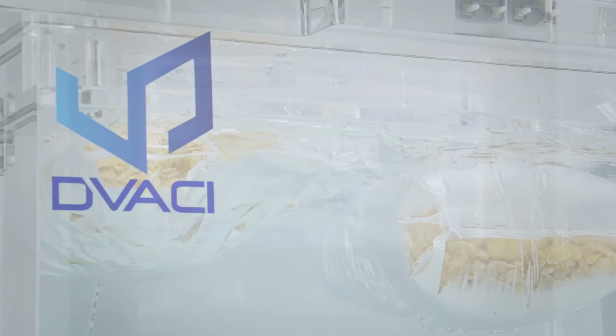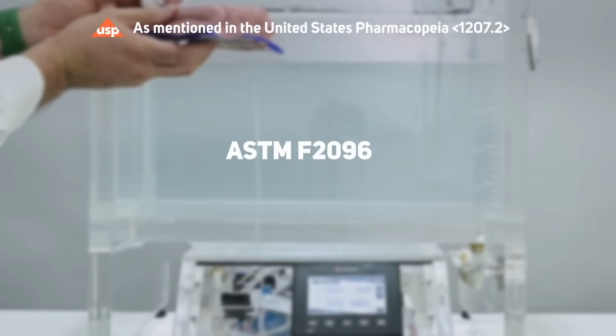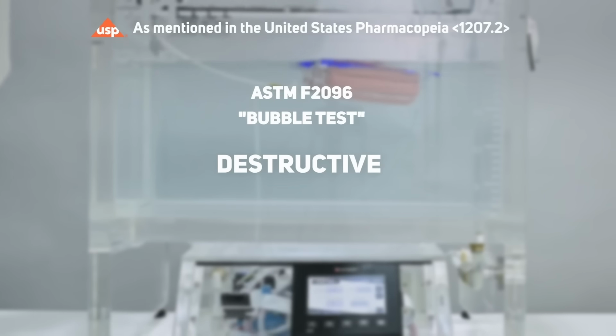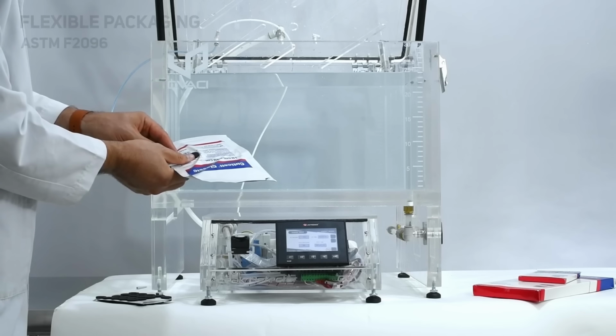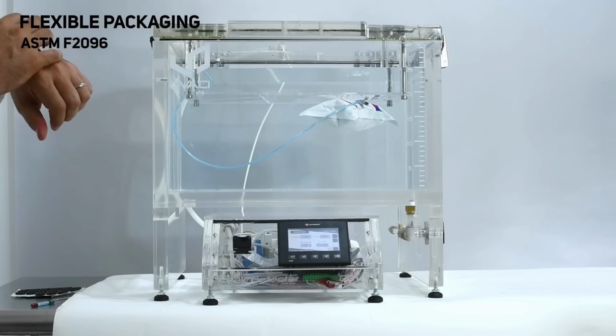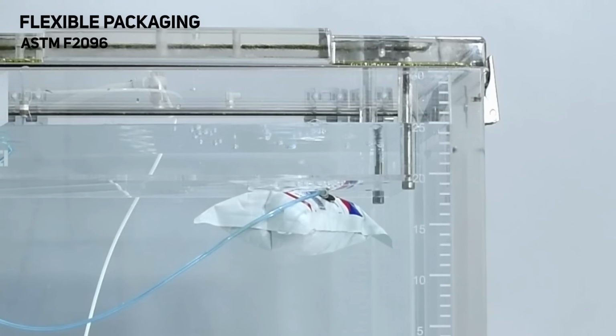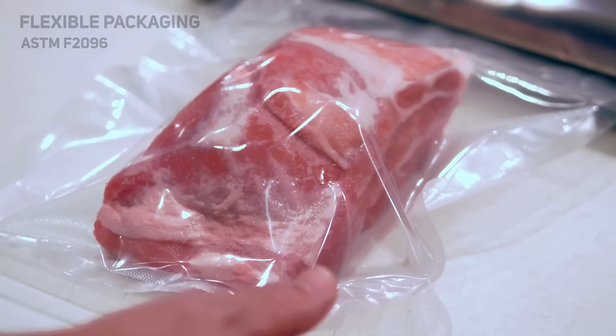We continue with the ASTM F2096 standard, which is also an immersion test. But instead of creating a vacuum in the chamber, we inject air directly into the product. This inflates the packaging and releases bubbles through any defects. This standard is suitable for products with air or vacuum-packed.